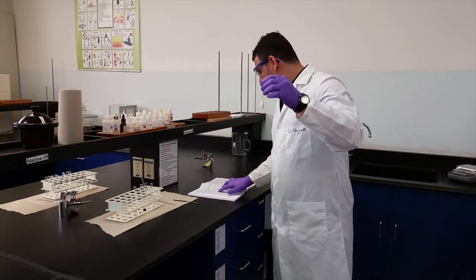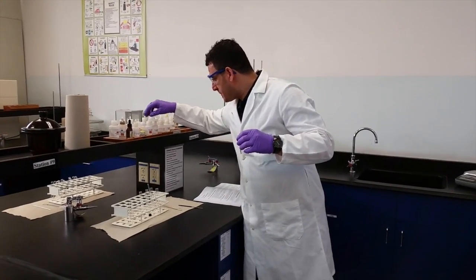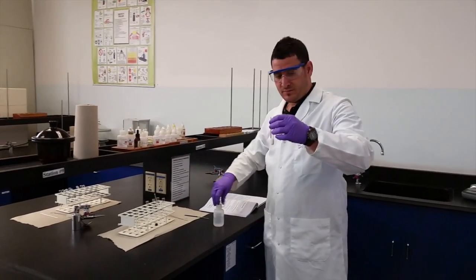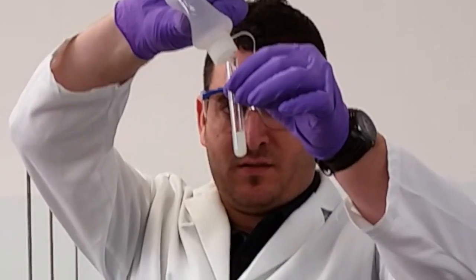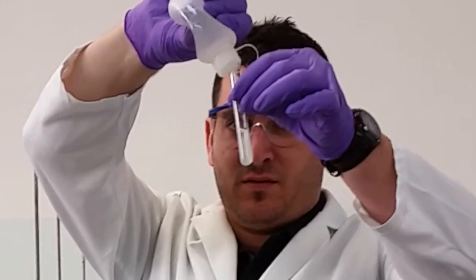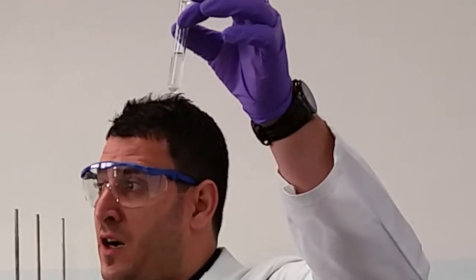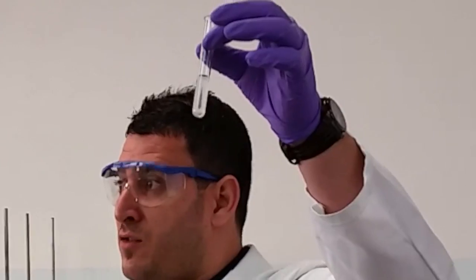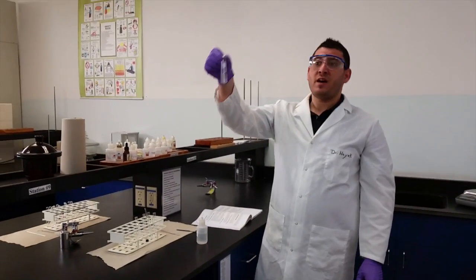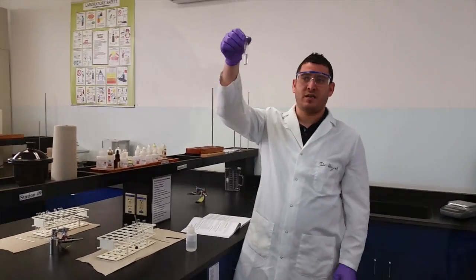For the iodide precipitate, which did not dissolve in ammonia, you will add sodium thiosulfate. These are the kinds of issues you need to learn how to handle in the lab. If you have too much, just transfer to another tube and do your test.